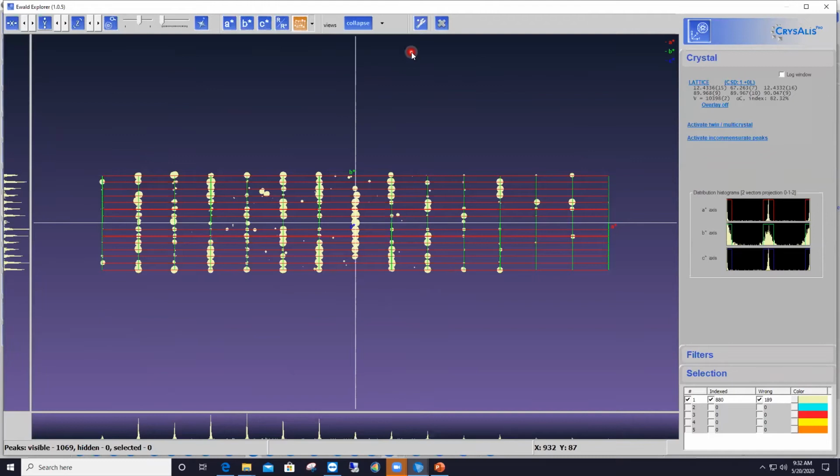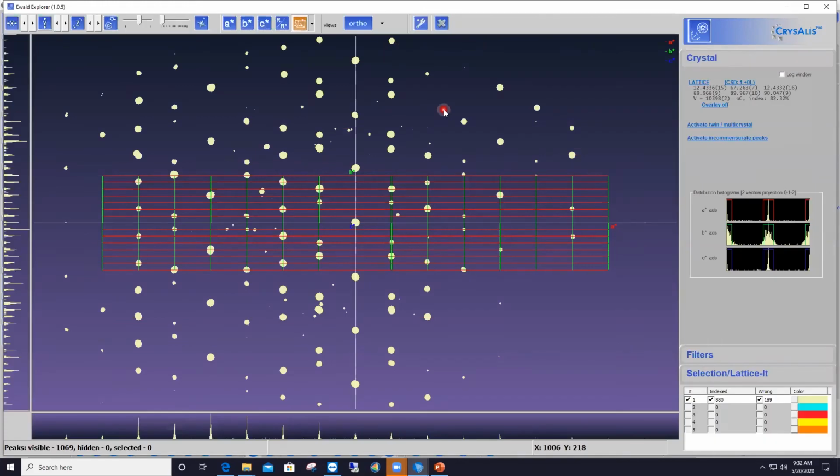And you see that when I do that, indeed, all the lattice points, or most of the lattice points, are now occupied by reflections. And that's why the program got confused, basically, and thought it had to have a lattice point at each one of these locations, and therefore the long 67 angstroms unit cell edge. But this is just a display gimmick. This is not real. The real diffraction pattern looks like that, and in that case, lots of lattice points are being left empty. So something is not right here in our indexing.